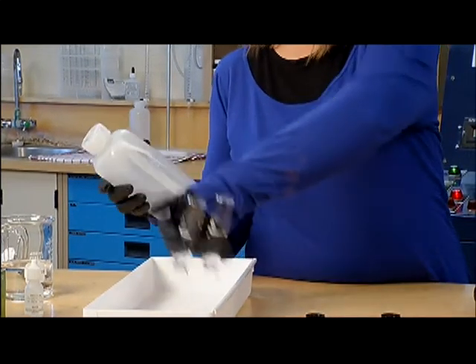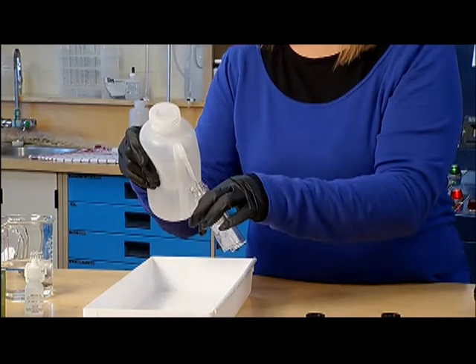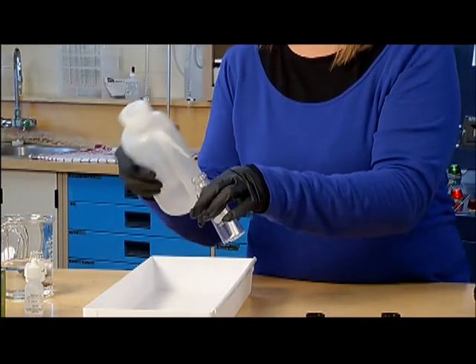While water is flushed through the sample tap, the operator prepared the materials she needed for the test.